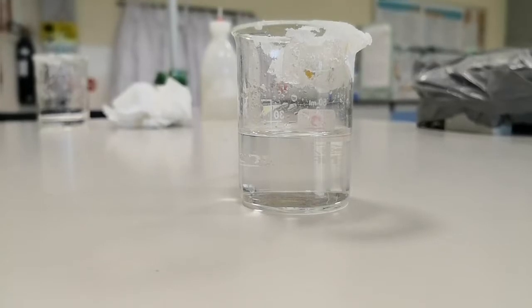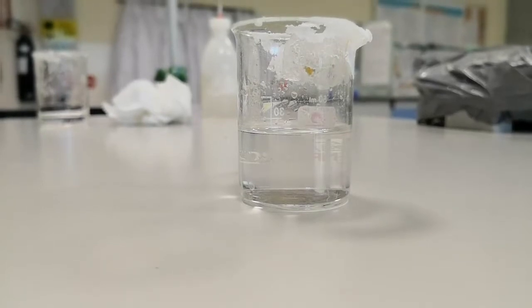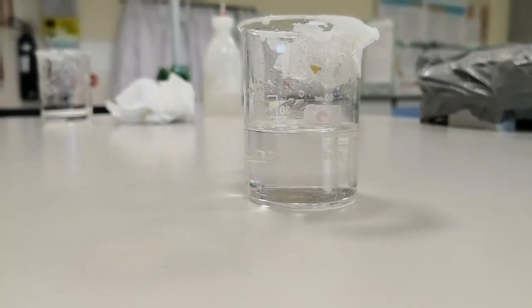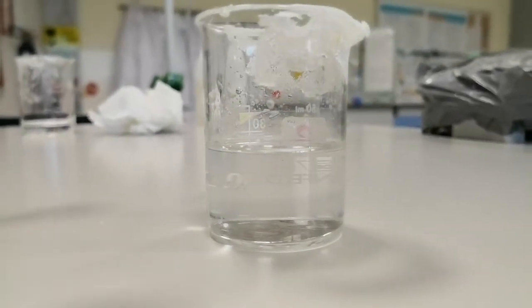We let it cool for a while and now we are going to add some crystals, crystal seeds, to this mixture to start the formation of the crystals inside the beaker.